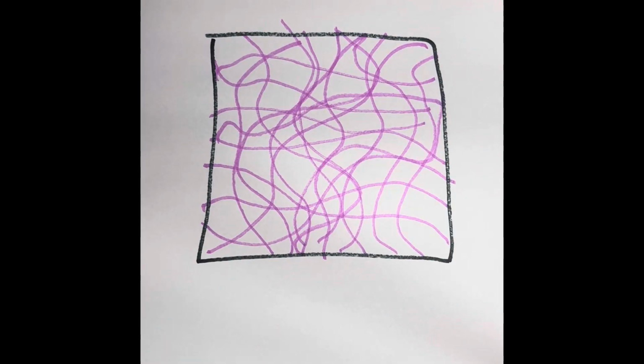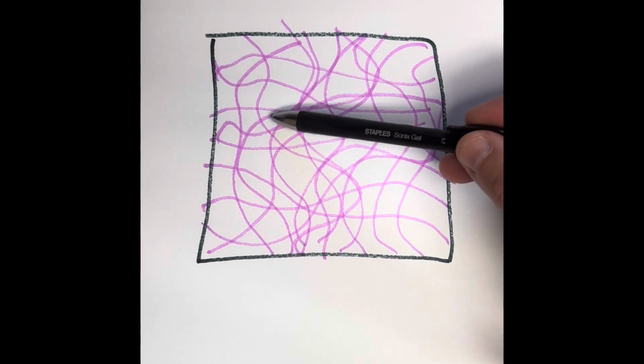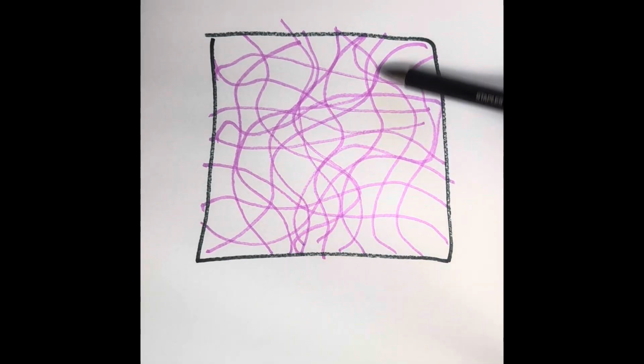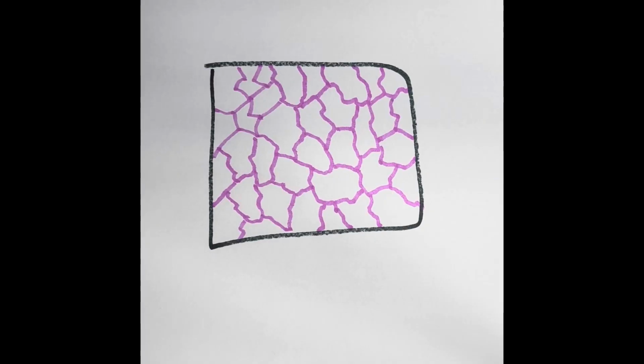Here's another fibrous connective tissue. This is the dense irregular. Dense irregular has fewer cells and a lot of collagen fibers. As you can see, as opposed to dense regular, this is irregular. The fibers go everywhere, not as organized. These do resist stress in multiple directions, and it is found in the dermis of the skin.